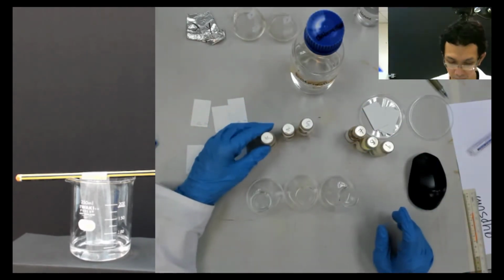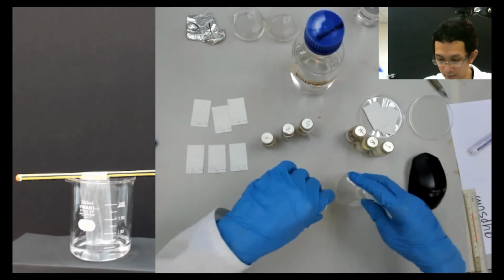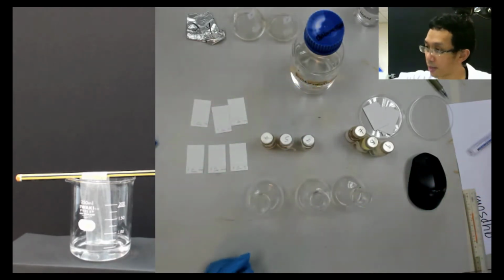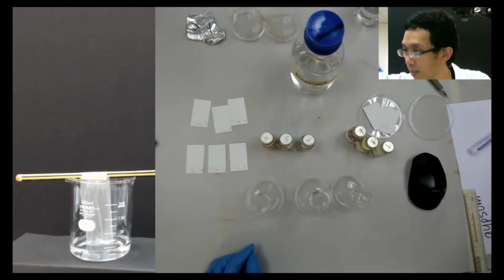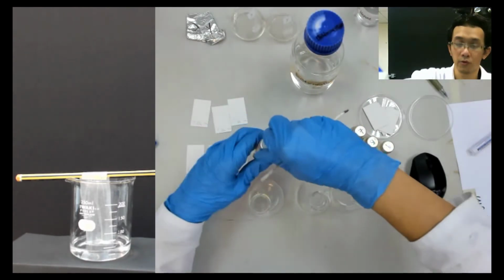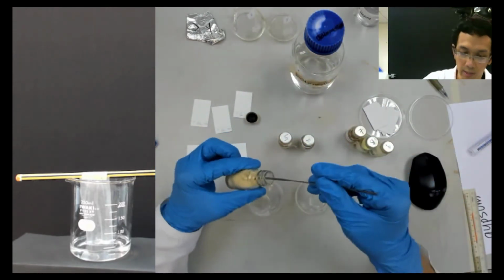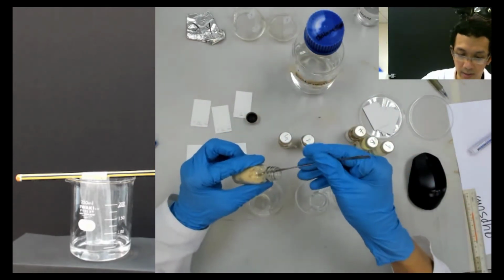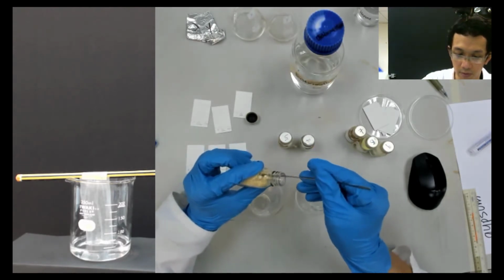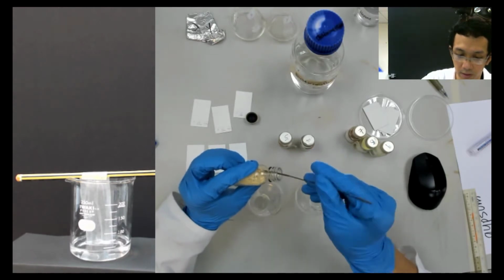So nitroacetophenone. So let me, this is naphthalene, this is vanillin. Okay, so now we can go to this. So nitroacetophenone. As usual, as before, just take some only. This one you already know what it is. Previously we didn't know, we just did it for X. Why is it so difficult to take?